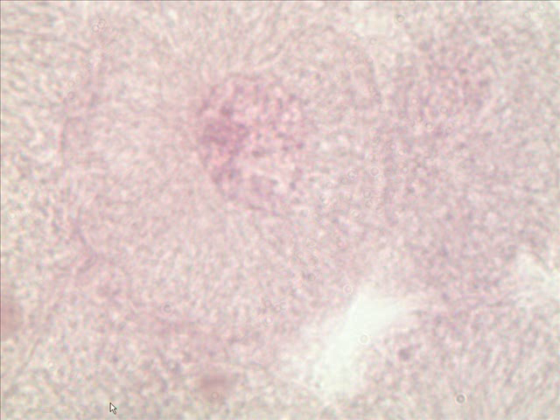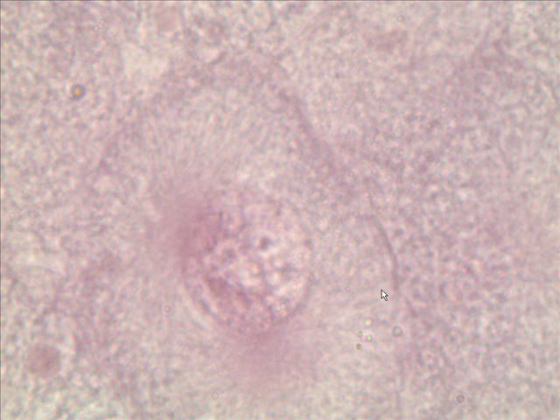You say, what am I looking at here? Well, here's the nucleus. You can't see any chromosomes. Here's the outside of the cell, like so. This cell is in interphase. So is this one. There's a nucleus right here. Here's the outside of the cell. You can't see any chromosomes in the nucleus because they're stretched out. They're uncoiled. You can't see them. So those two are interphase.